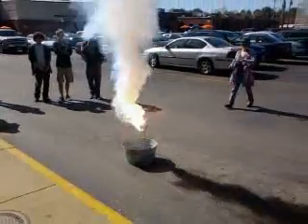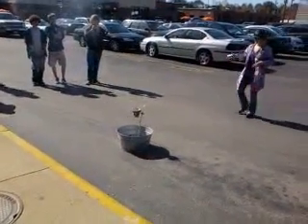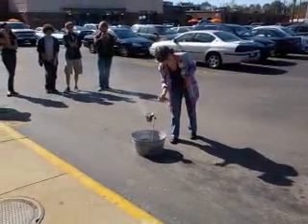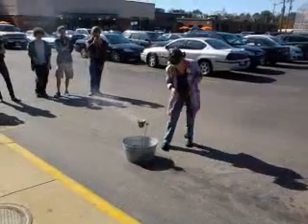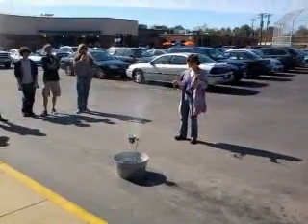Oh, my God. That's the one of them. That was so weird. I like how if you, like, touch that, it doesn't really look like it's burning, though. Oh, it did. Never mind. It burns. Baby thermite reactions. That's what I can do. Sorry.